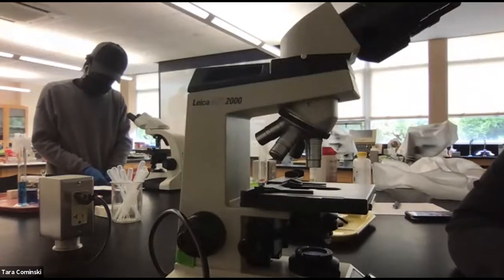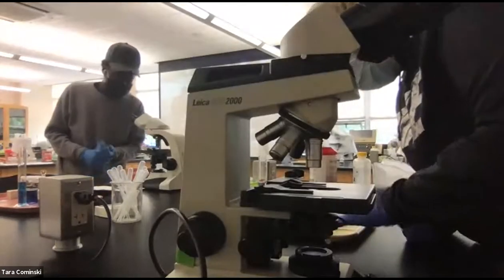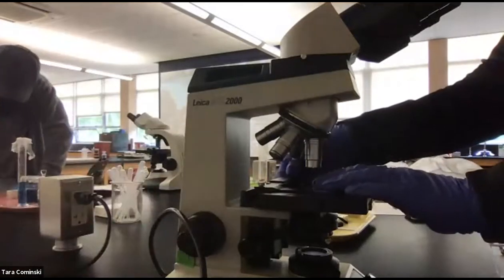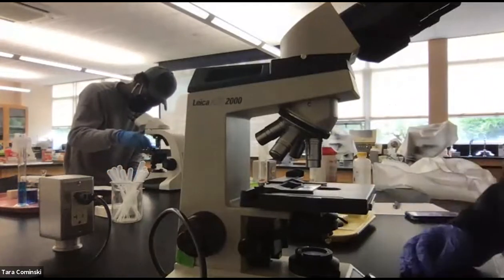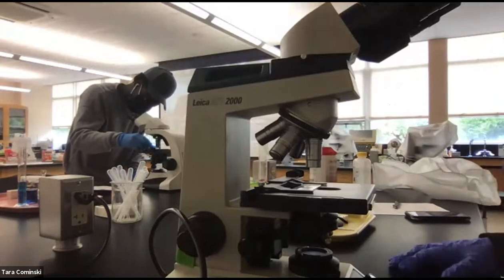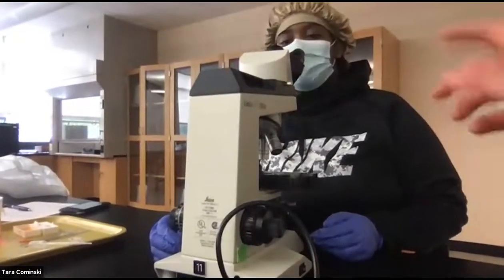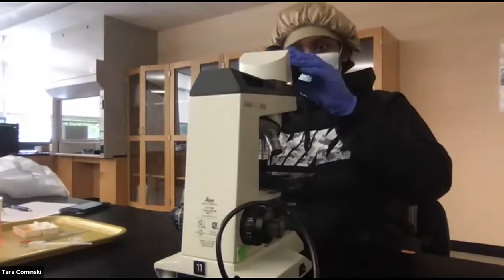Now you're going to take your letter E slide. It's not a letter A. I don't know why I wrote letter A on there, but anyway. Okay, and we're going to place it on the stage here. You pull the one side, you got it. Slide it all the way back. All right, cool. Now we want to get that letter E in focus, okay? So under this scanning power, I'll move this so we don't knock it over. I've already probably knocked it over. All right, so now you want to get that in focus. One question. Yeah. Can I open it? Okay, you can.